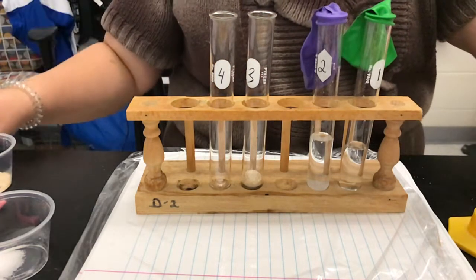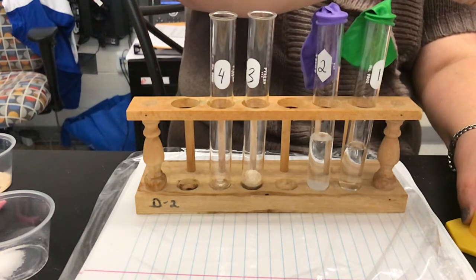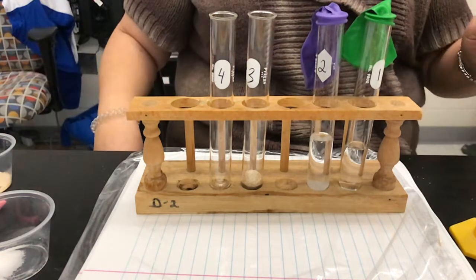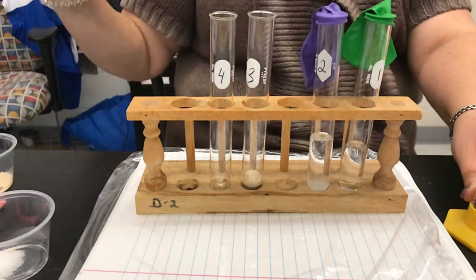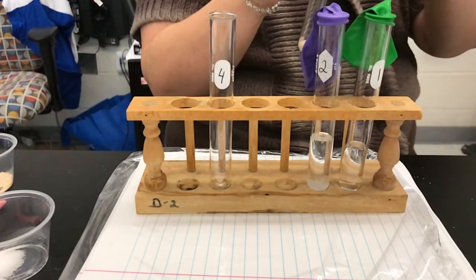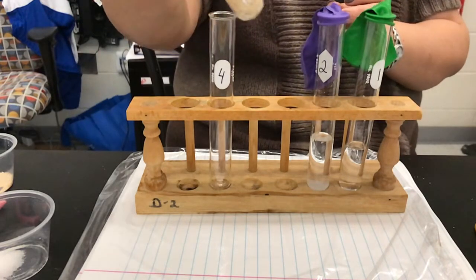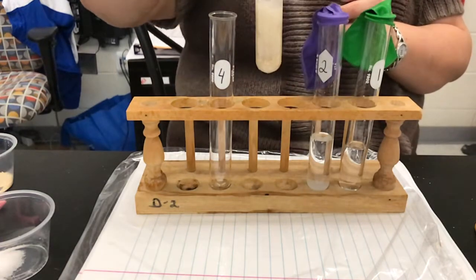Got to measure out our water. Anybody know what this is called? A pipette, right. Did you ever see the short film Piper? The little Disney Pixar film? Piper birds have a beak like this because they peck at the beach — little birds that run real fast right down by the water. We'll shake this up. There's our yeast with our water.